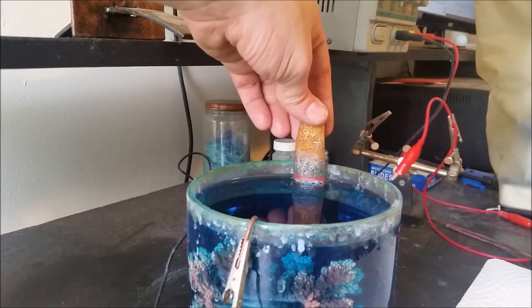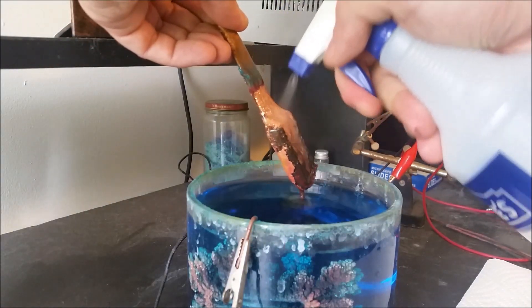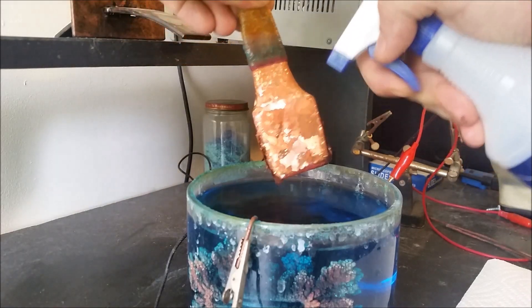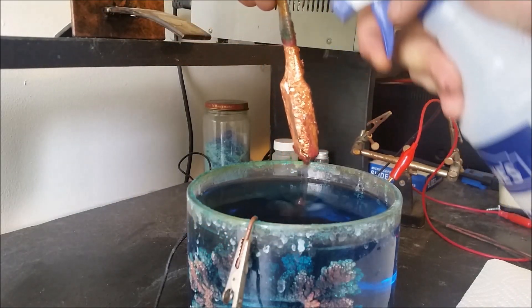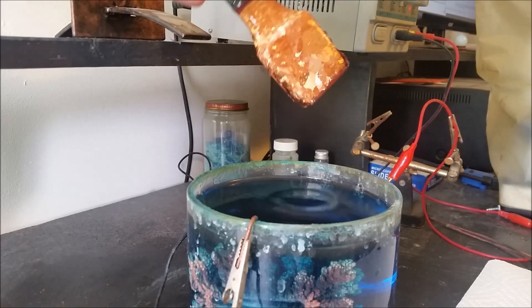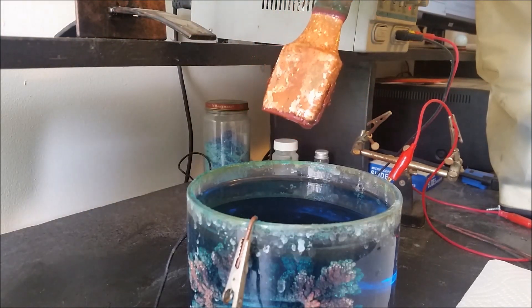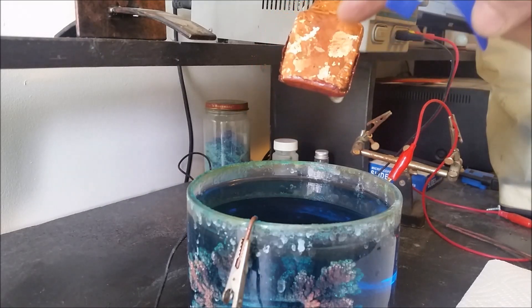First I'm going to disconnect the anode and wash it into the solution. It's got a pretty crystal structure — once that surface is removed, these are the crystals that form after being poured once it's molten and slowly cools down. That's how those grow, and the bigger the crystal, the slower it cooled.